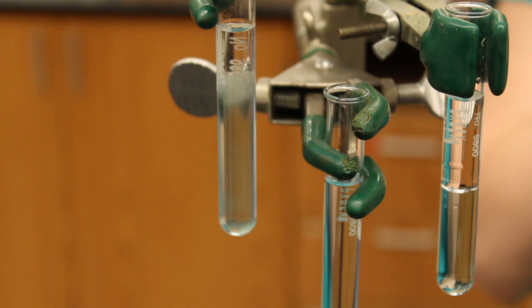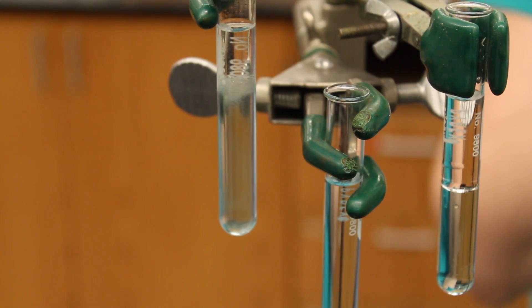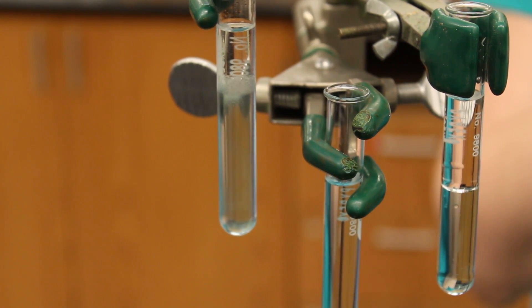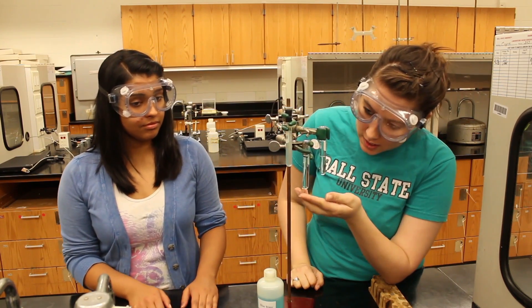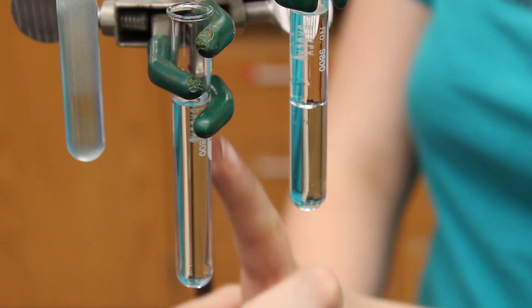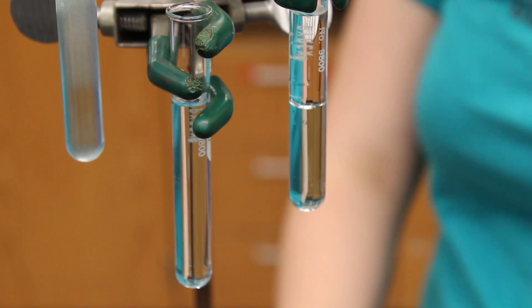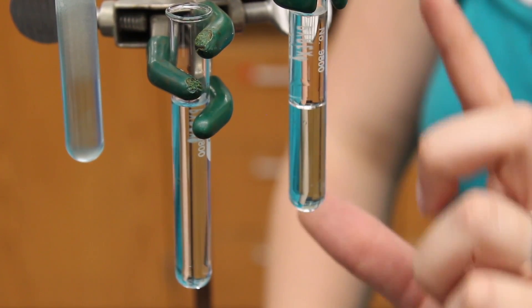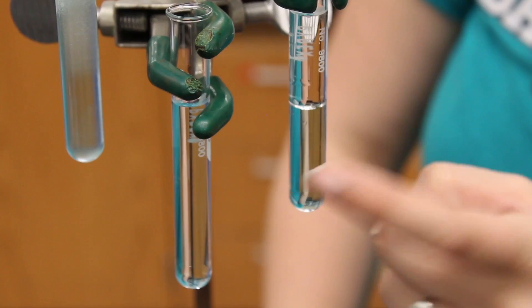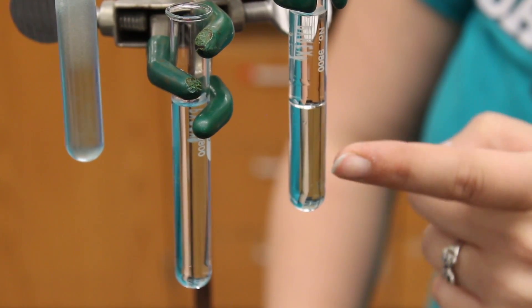Once the bubbles settle, you'll be able to tell if it's soluble or not and record your solubility. If something is water soluble, it'll look like this, with no visible breaks in the solution. If it's water insoluble, it'll look like this one, with a clear break within the solution of about equal volume.